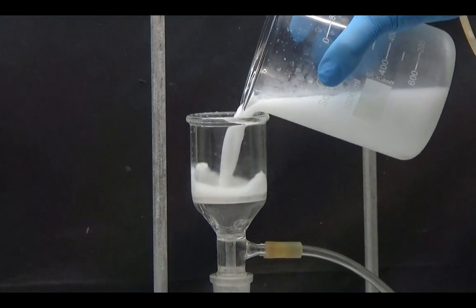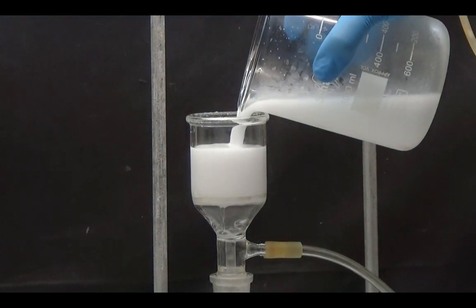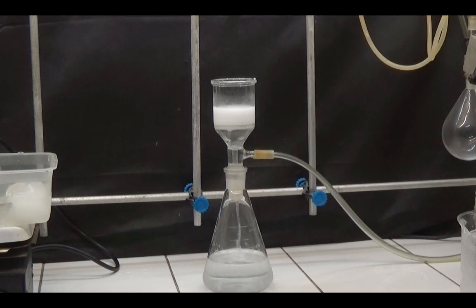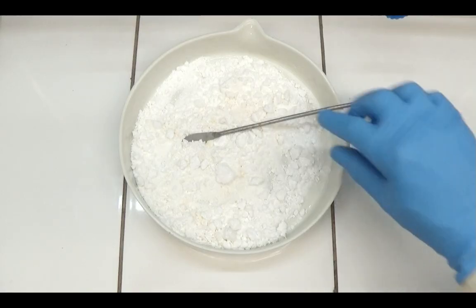Store in the refrigerator for a day. Collect the solid using suction. Dry in the oven at 80 degrees.